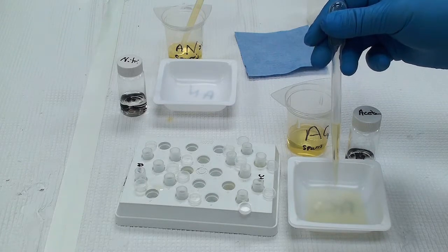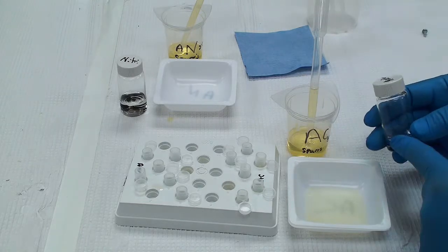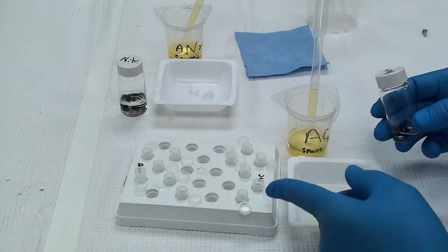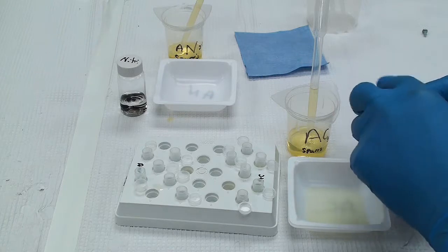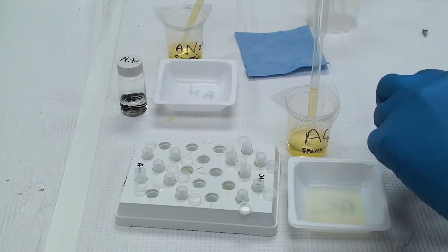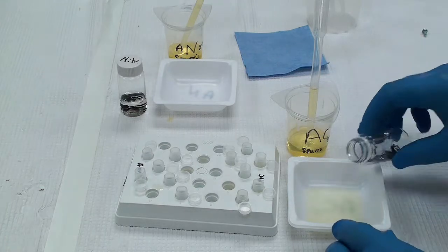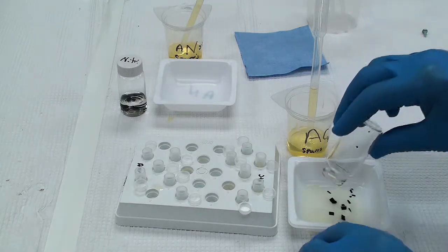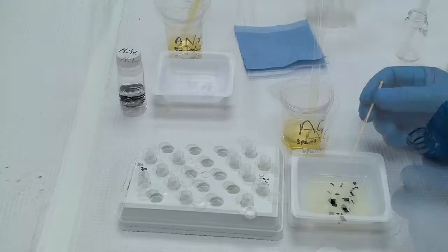I'll put some resin and dehydrant mixture into the bowl because I'm going to just dump it out. And since I'm working with acetone, which is particularly volatile, if I were to just dump that out, they may dry out before I get them into the sample holder. So I don't want to have that happen. So we'll just dump those in there and that way they have resin which will keep them moist.